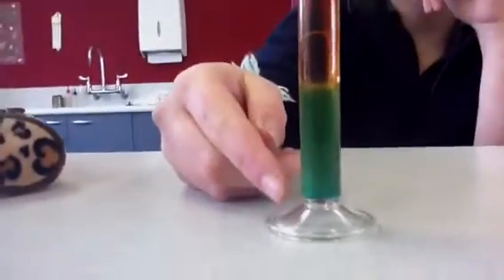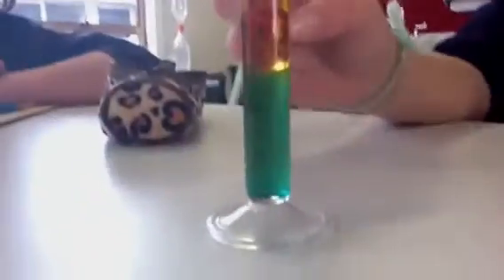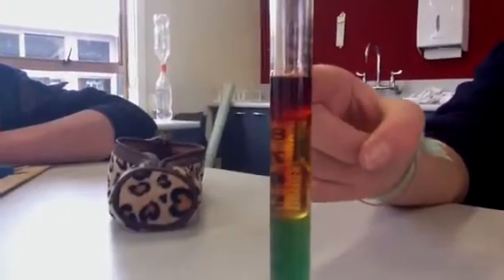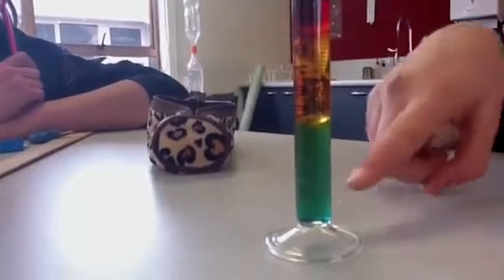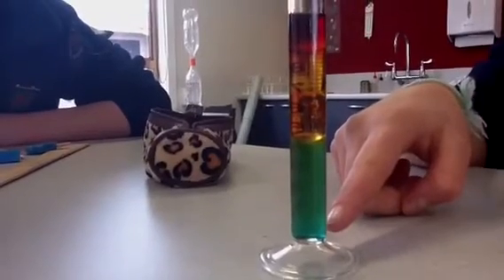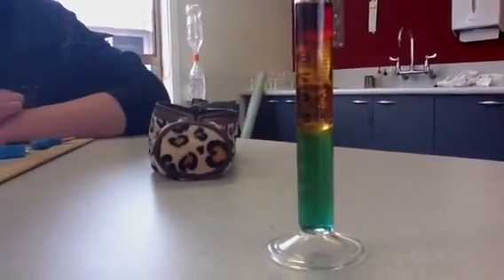What's on the bottom? The blue on the bottom is the sulfate stuff, and then the water, and then oil. And then the mineral. And then it's the purple hexane. So which is the most dense? The one with the biggest number — the copper sulfate. And which is the least dense? The hexane. The hexane on the top. So you've got five layers.